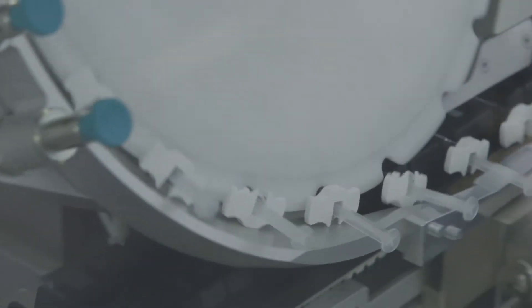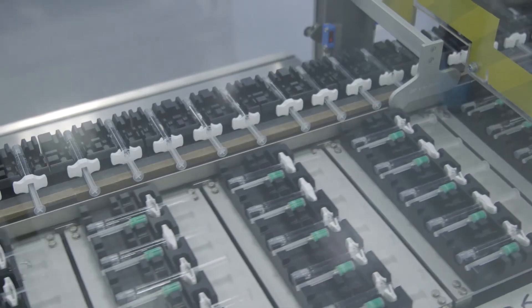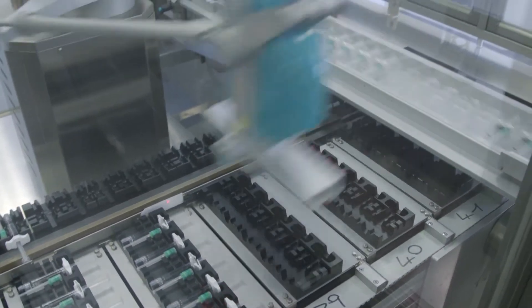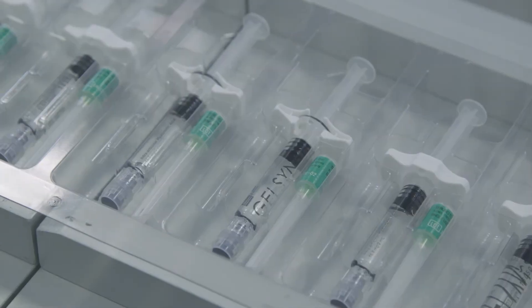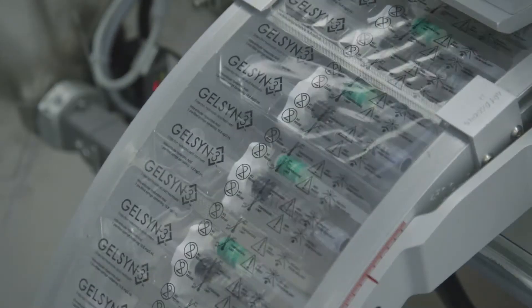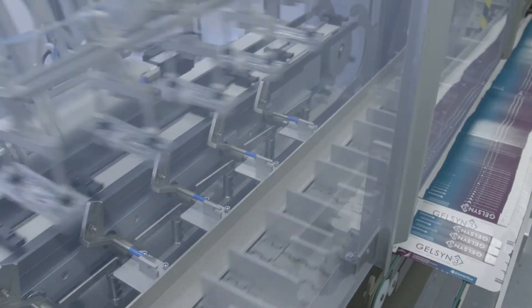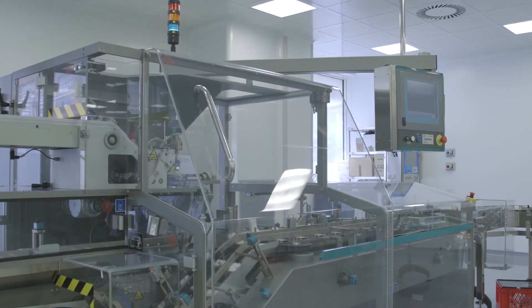a sterile needle. A robot then positions them in the PVC blister, and a vision system checks for the correct contents of each blister.